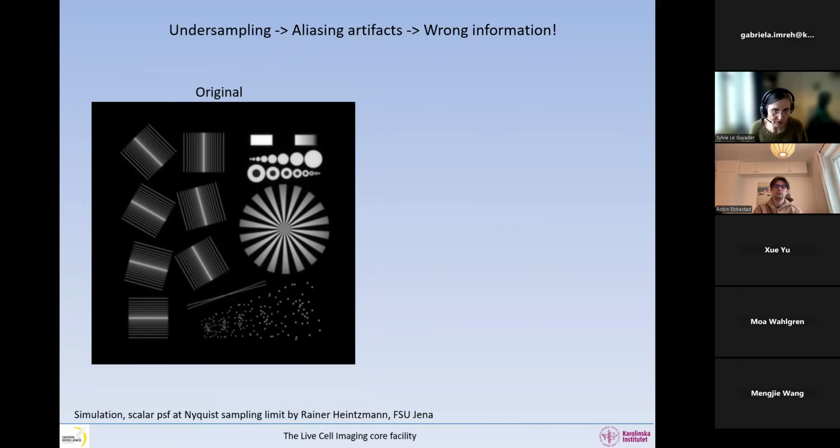Because in biology, we undersample a lot. If you listen to any physicist, they're going to tell you never undersample because the information is wrong. So in here, you can see he created all these objects with different orientations and different frequencies, right? Because physicists love frequencies. In this one, we have a very fine object with a little black dot in the middle. And then we have all this.